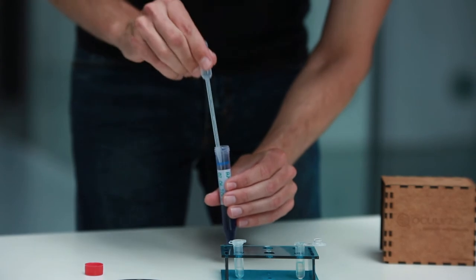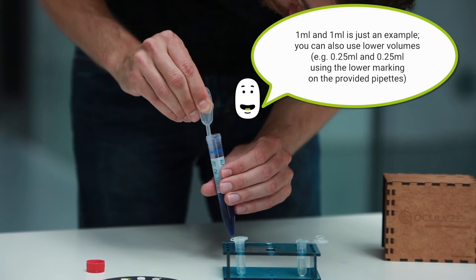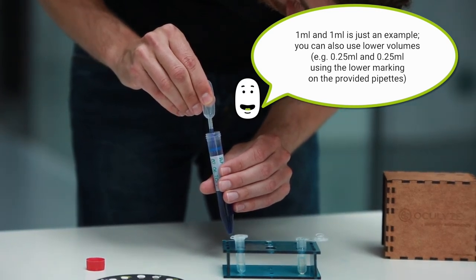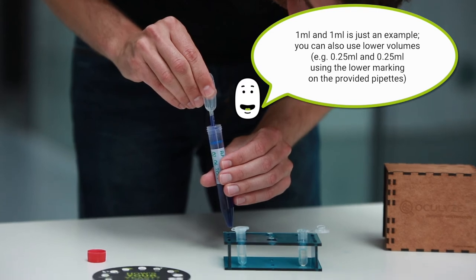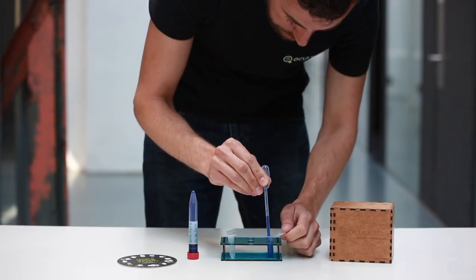Take the 1 ml of diluted yeast sample and put it into the reaction tube. Step 2. Take 1 ml of the methylene blue solution and put it into the reaction tube. Step 3. Run the mixture through the pipette a few times.